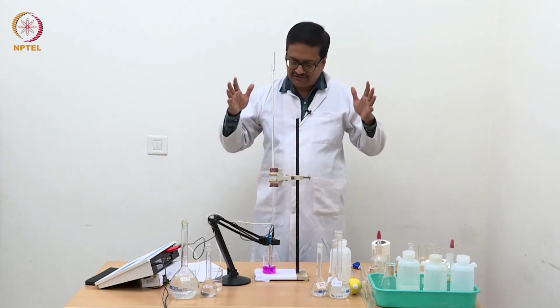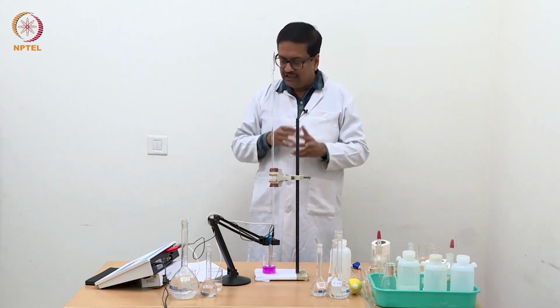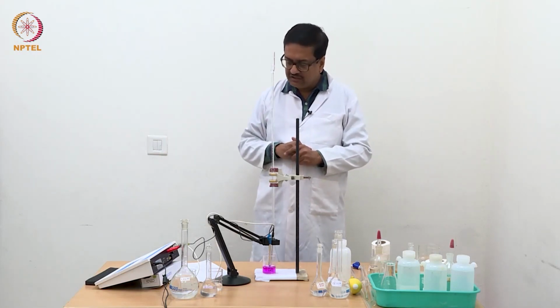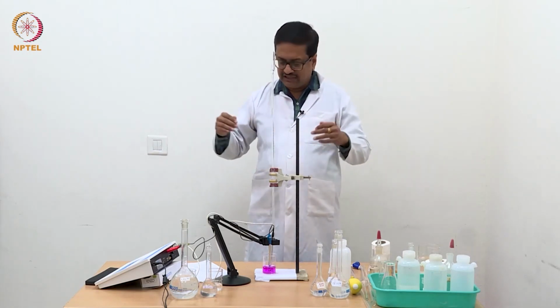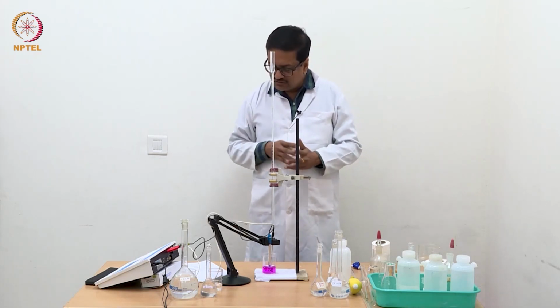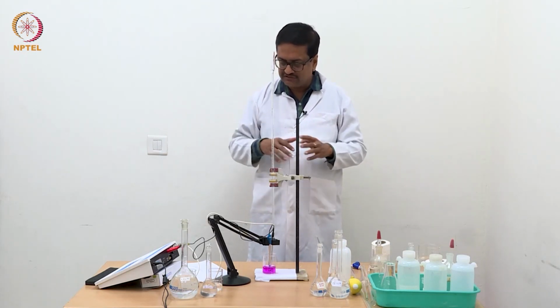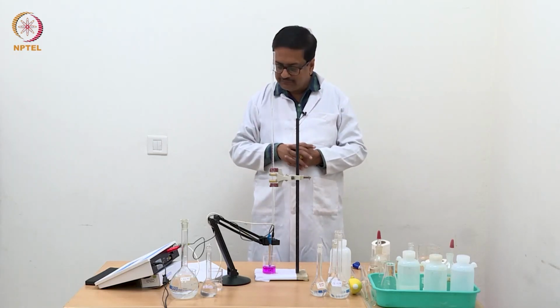That is because acetic acid starts to dissociate when there is a lack of H plus ion in solution, and it dissociates more and more and generates more H plus ions. As a result, the conductance was increasing, but that increase was very small, in the sense every time it was increasing by about 10 to 15 microsiemens, and it continued increasing from about 104 microsiemens to 130 microsiemens, slowly, gradually over a range up to 0.5 ml.